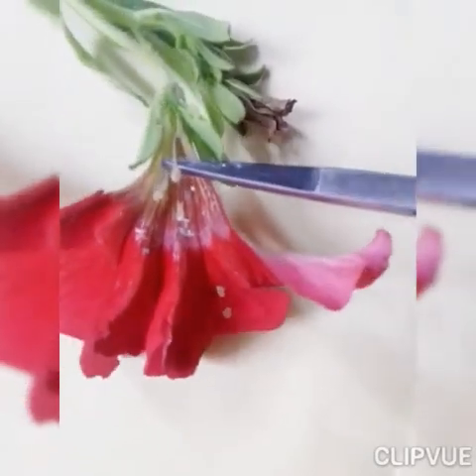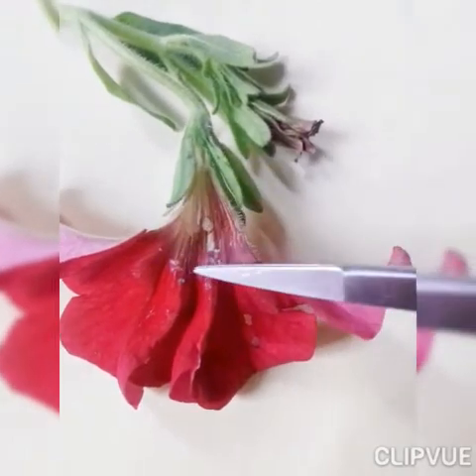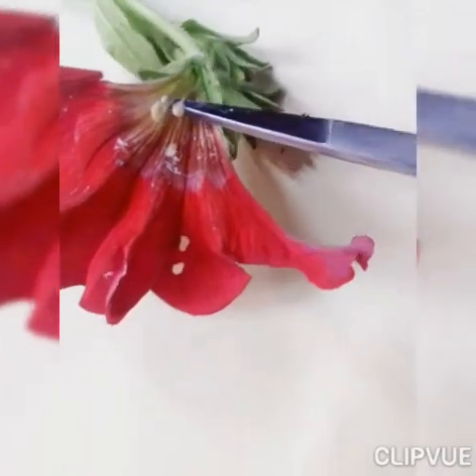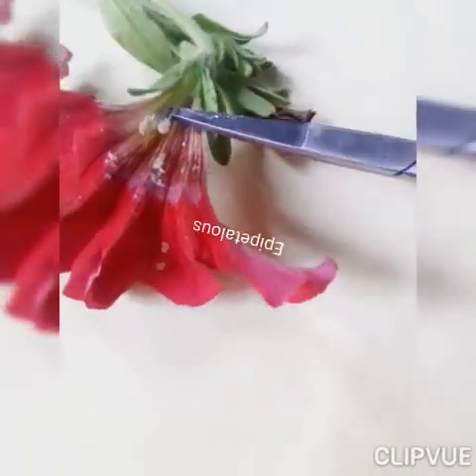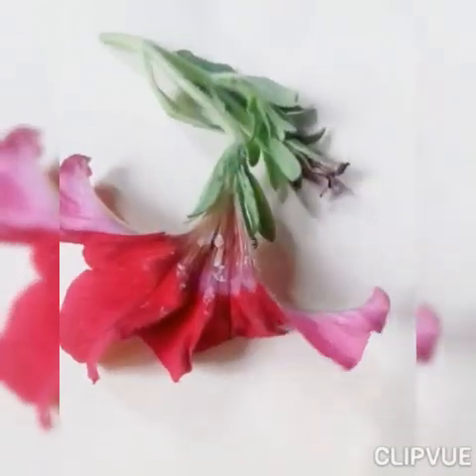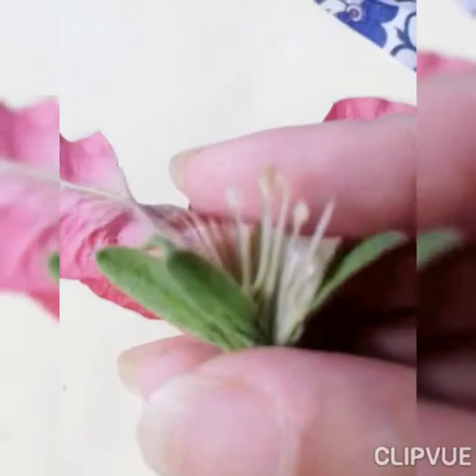You can see these are the stamens — the male part of the flower. These stamens are attached with the petals, so this condition is called epipetalous. Petunia has epipetalous flowers. You can see here clearly the petals, and the stamens are attached with the petals.